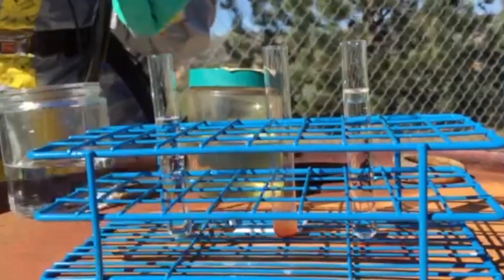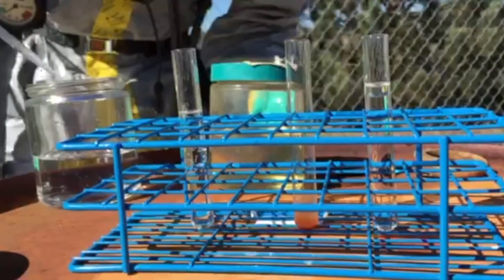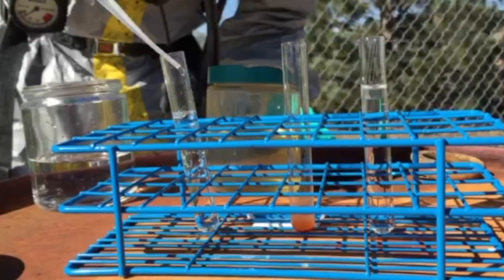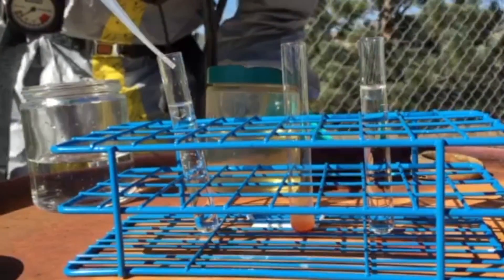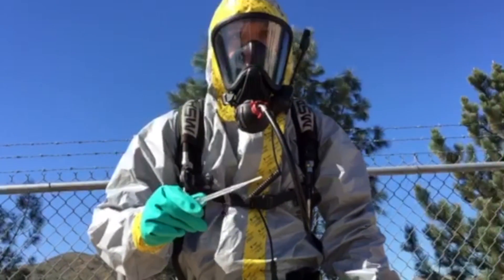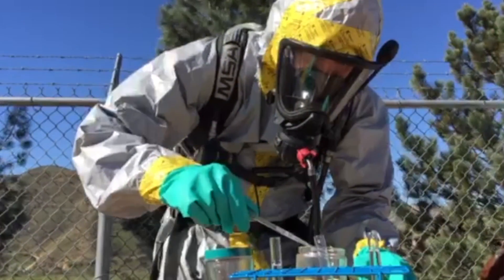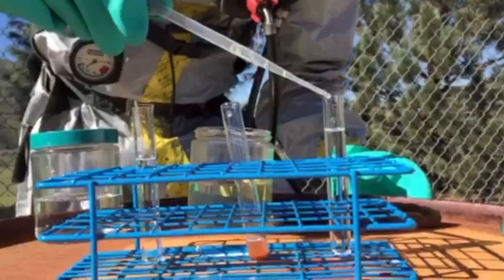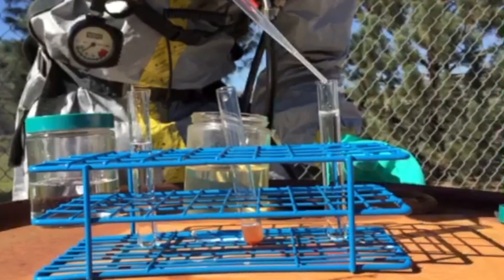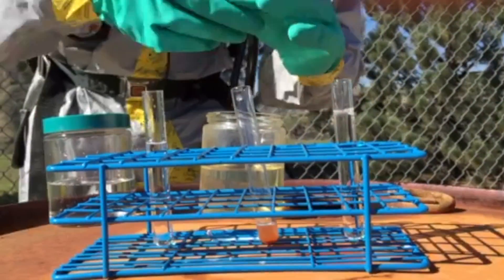Now let's test for solubility and specific gravity. Fill two test tubes about halfway with water, and add a small amount of the sample and some oil. If it is not soluble, it will either float or sink, depending on the specific gravity — if it's less than one, it will float; if it's greater than one, it will sink. In this case, the oil floated while our sample was miscible and mixed with the water itself.